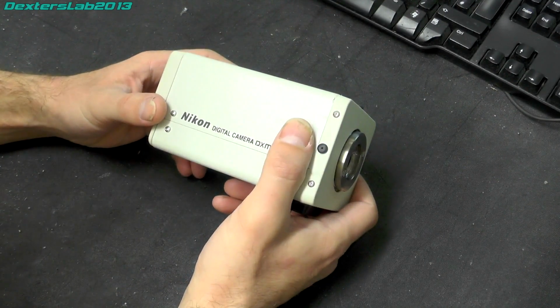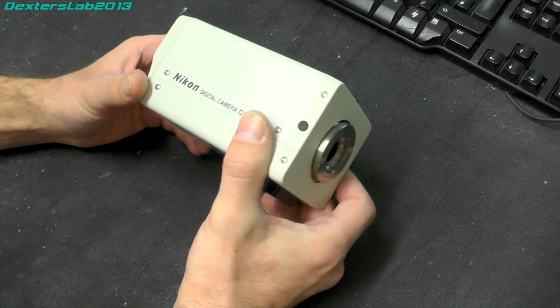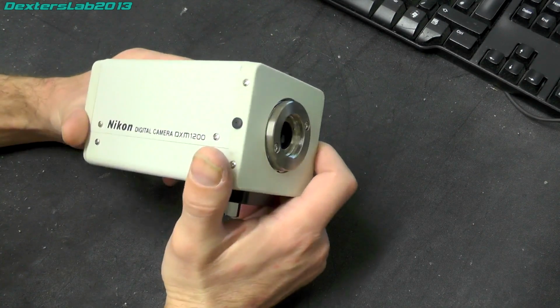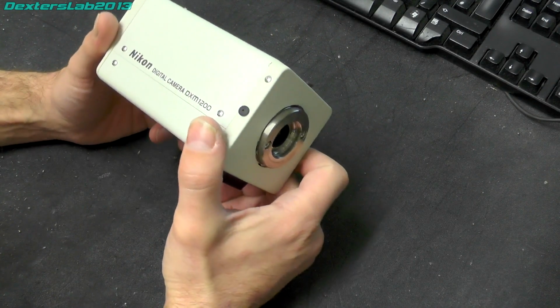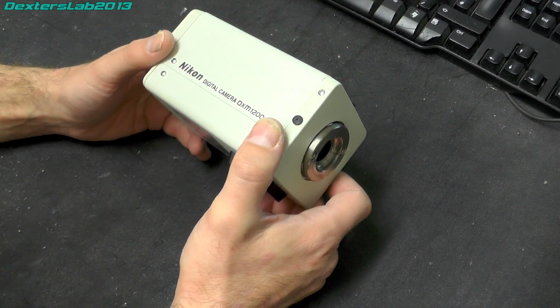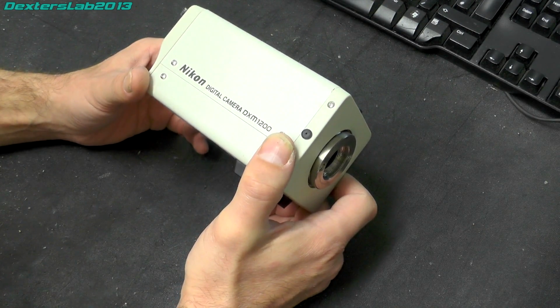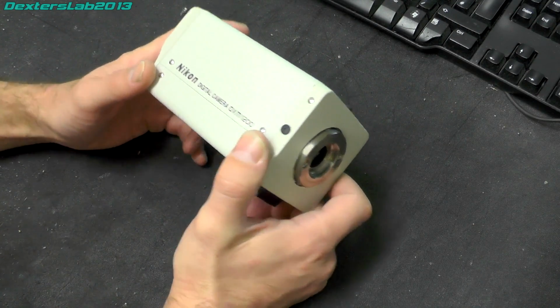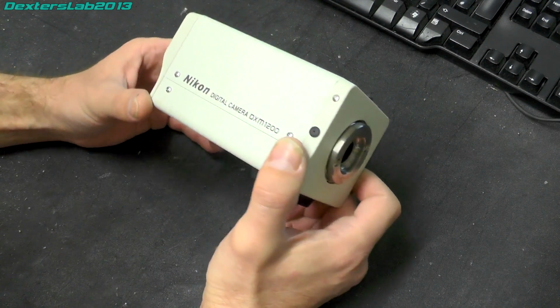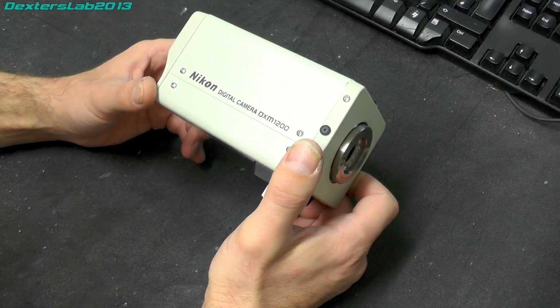So to pull a few excerpts out of the marketing blurb for this, microscopists who have been asking for a colour digital camera that offers a resolution nearly equal to film will welcome the new Nikon DXM1200, blah blah blah. Designed to meet demanding needs, blah blah. The DXM1200 uses Nikon's new IPS high density imaging technology, which is interpixel stepping, to provide breathtaking original digital images, true to life, extremely high quality 12 megapixel resolution photographs are sharp enough to be blown up and printed poster size, etc. etc.